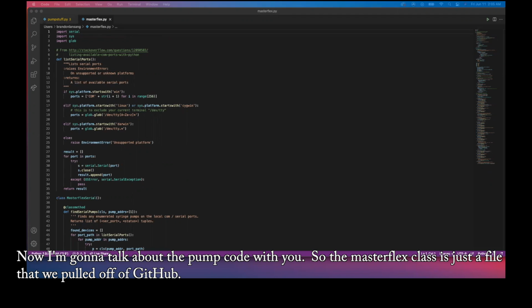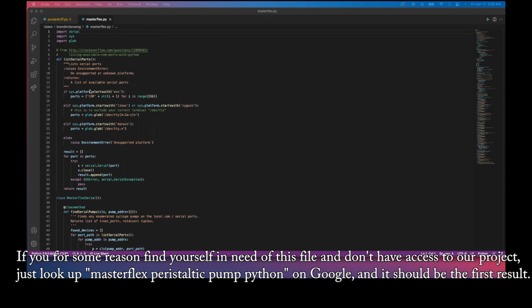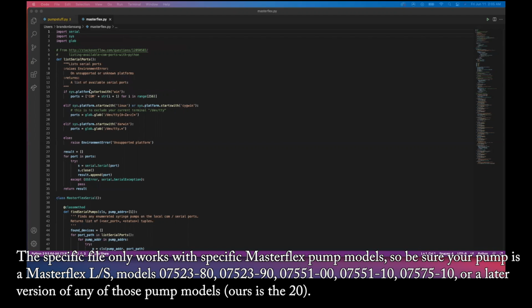Now I'm going to talk about the pump code with you. So the Masterflex class is just a file that we pulled off of GitHub. If you, for some reason, find yourself in need of this file and don't have access to our project, just look up Masterflex peristaltic pump Python on Google, and this should be the first result. The particular file only works with specific Masterflex pump models, so be sure your pump model is a Masterflex LS pump model.